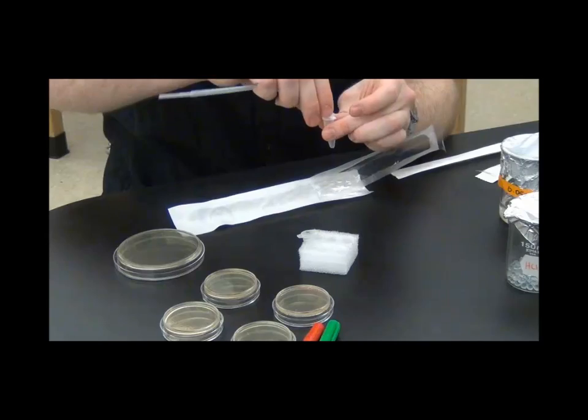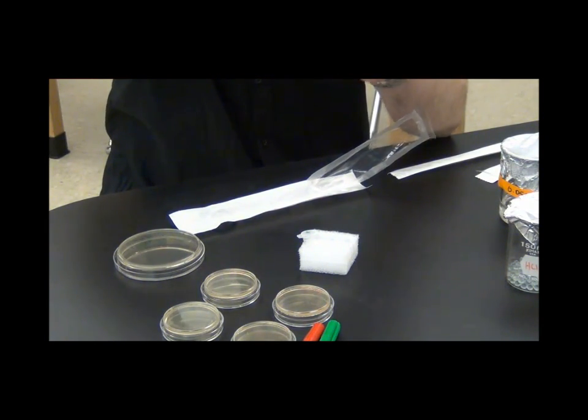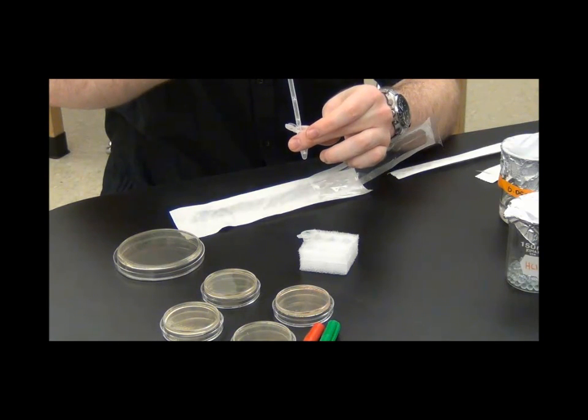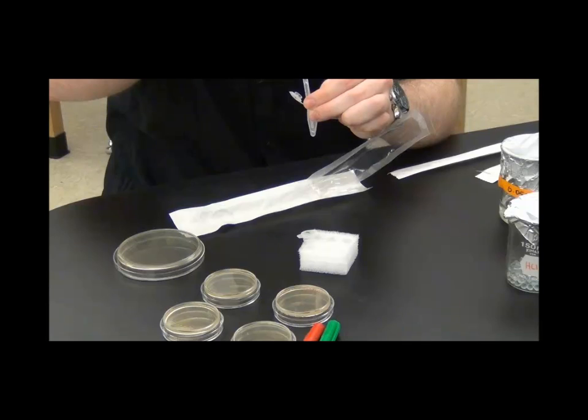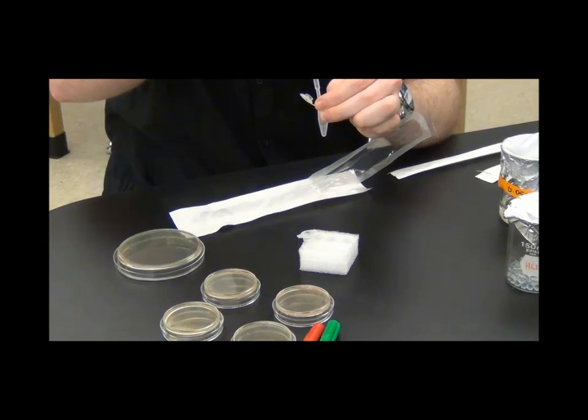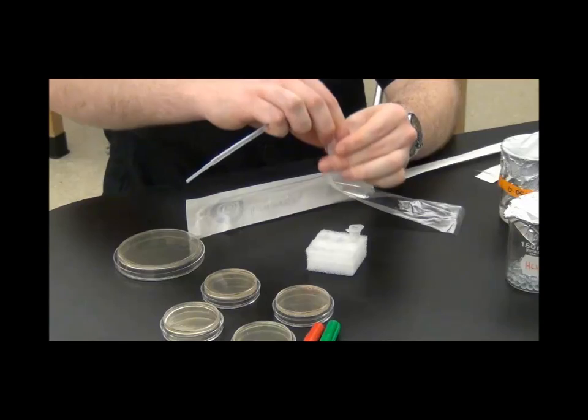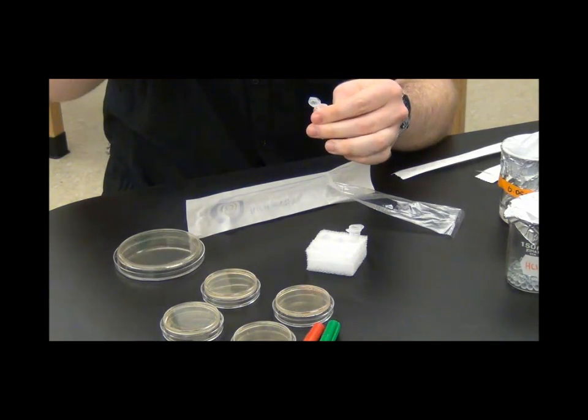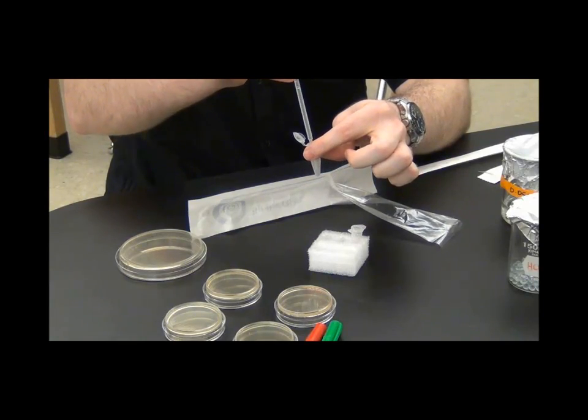Then you're ready to use your first sterile pipette. This sterile pipette is basically just going to be used to draw up and kind of push out the liquid constantly. You're just trying to mix the bacteria and the calcium chloride liquid together. If you see clumps of white in your container still you need to mix some more because you're not done yet. And you need to do this with both tubes. You can actually use the same pipette for both tubes because we haven't done anything to them differently yet.